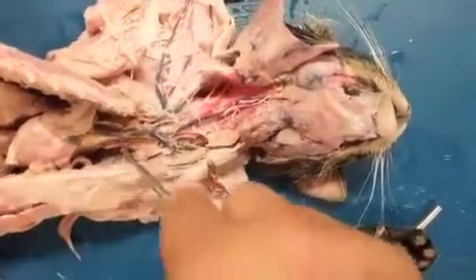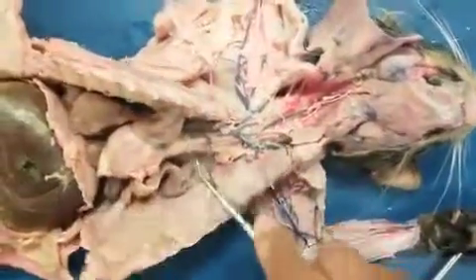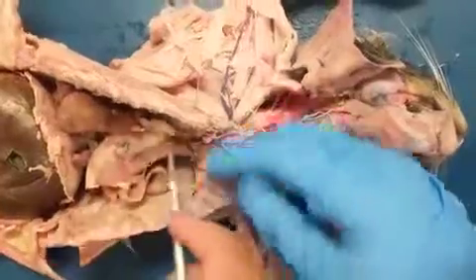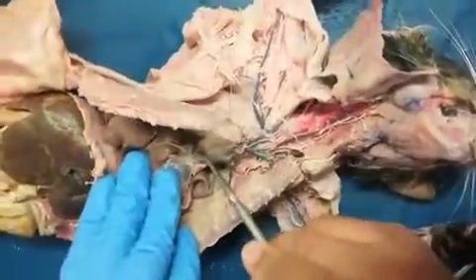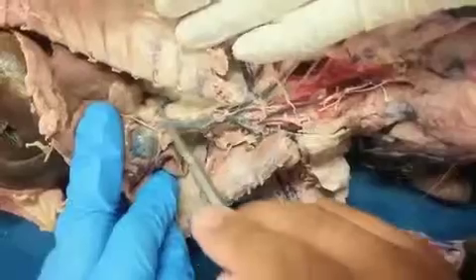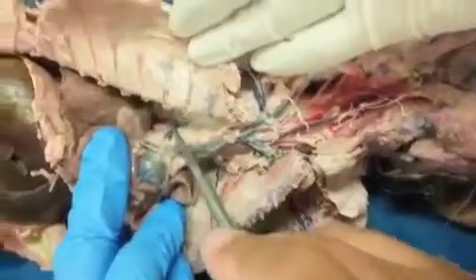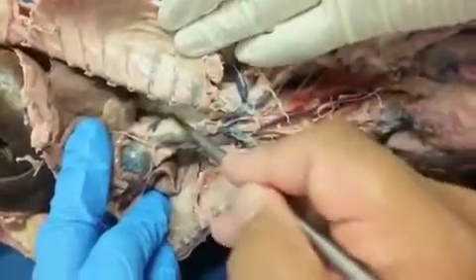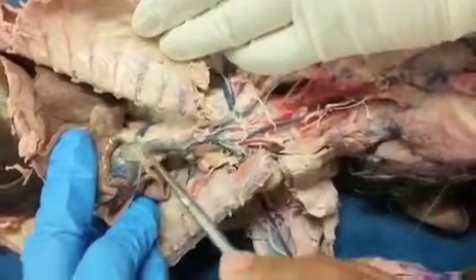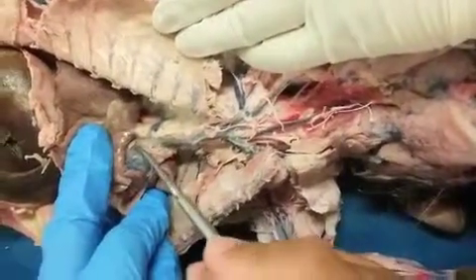Now, once we drain into that superior vena cava, from here, I'm going to need you to do some digging here. Bring these lungs over towards the left. Right back there, you see the azygous vein. And that's not cat specific, right? No, humans have this too. So this is going to drain all of the intercostal veins that you're seeing here. They'll drain into that azygous. The azygous then drains into the superior vena cava. And the superior vena cava drains into the right atrium.